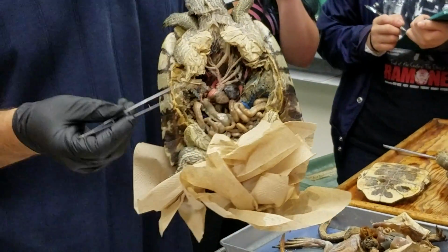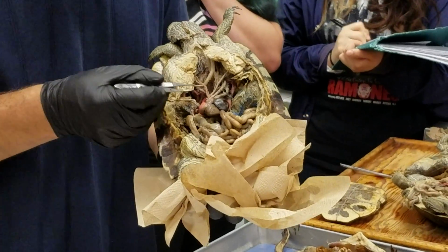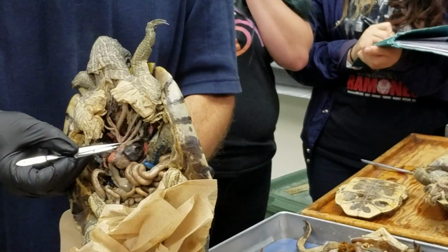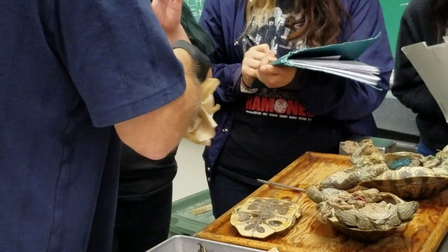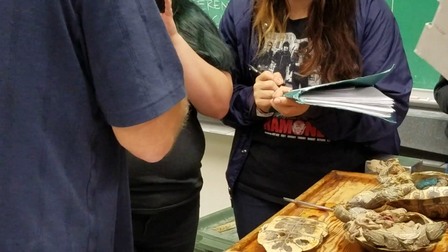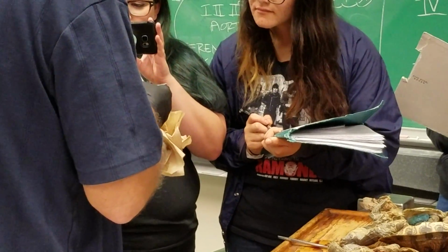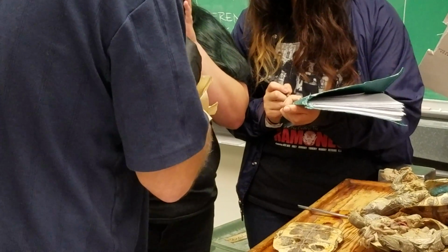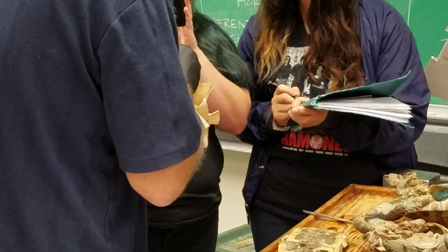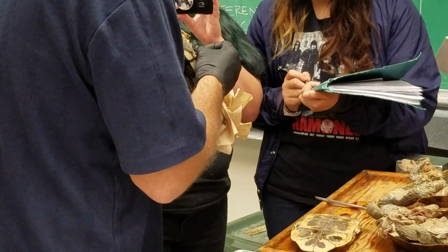Okay, those are pretty simple. The last one is the complicated one, and that's the right systemic trunk, which is this whole thing here. Okay, and the right systemic trunk is going to give rise to the brachiocephalic artery here, which is branching to give off the subclavian arteries running to the limbs, and also the common carotid artery that's going up to the head.